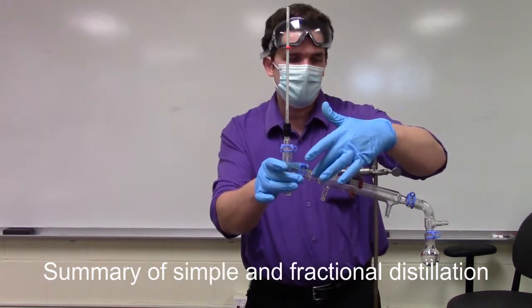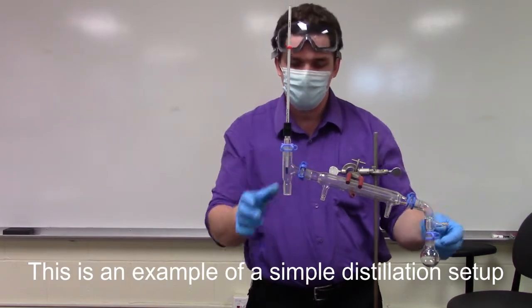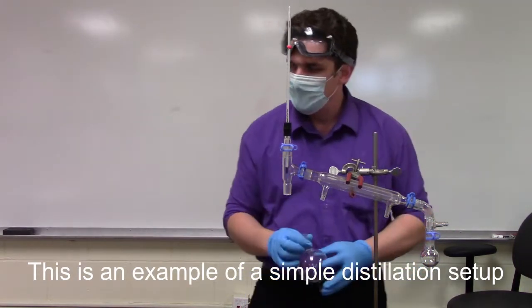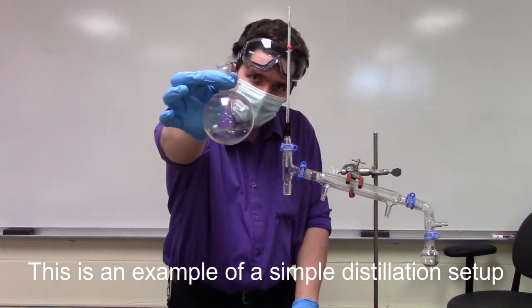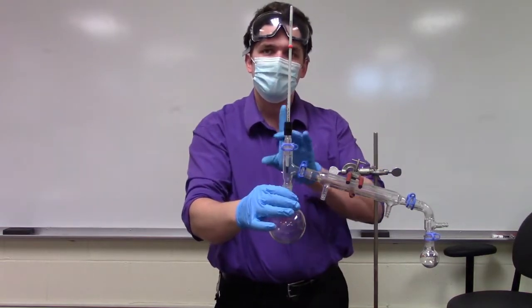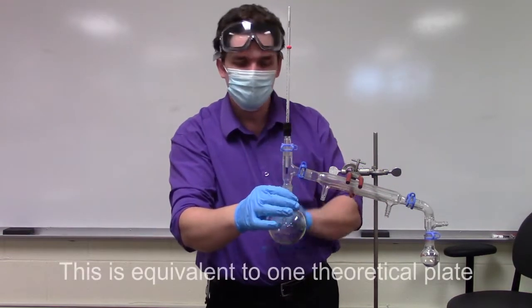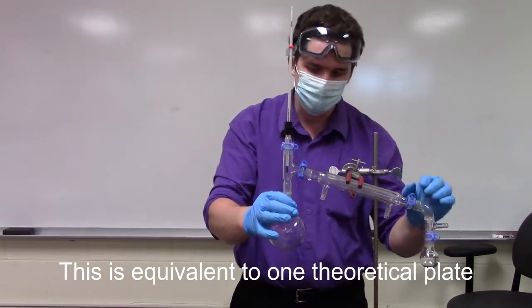We have the distillation head, the condenser column, the receiving flask, and we've got this vacuum adapter if we want to attach a vacuum. And to attach our distillation flask, take a round bottom and we would attach it directly here. So what's going to happen is that basically this is the equivalent of having one theoretical plate. Boils off the round bottom and the vapors get condensed and come down the column.